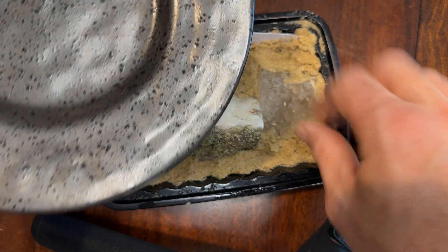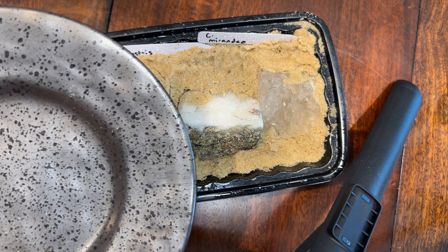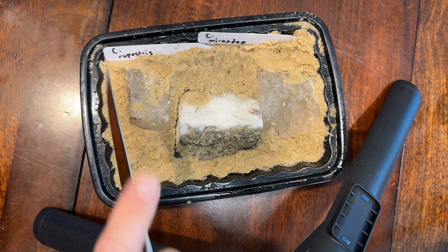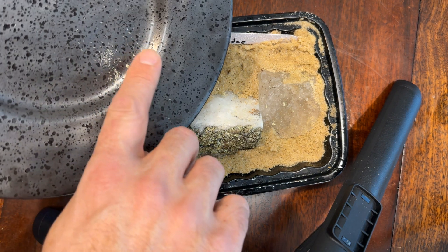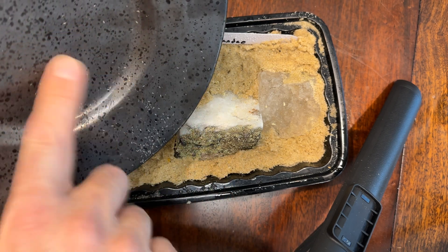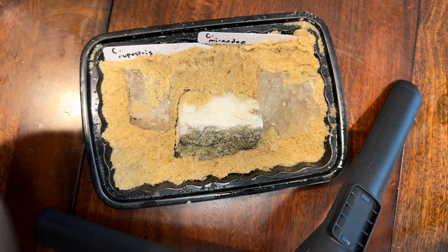As you can imagine, these things are going to be incredibly delicate. I want to check the tip of my knife to make sure there are no additional seeds there. I'll just kind of spread it around. Not sure how good a job I'm doing at keeping it somewhat evenly spread, or if I'm mixing some of the seeds up, especially here in the middle. I don't think it matters too much because we'll be able to figure it out later. This is the experiment. I'll make sure I get all these seeds off the knife.